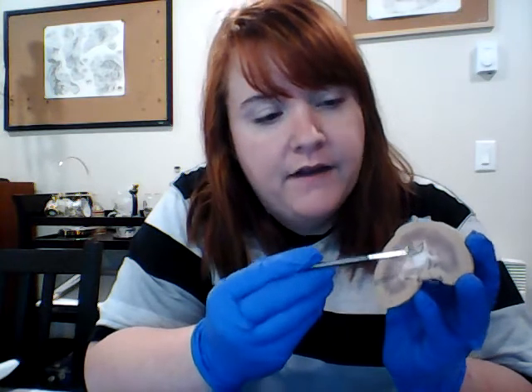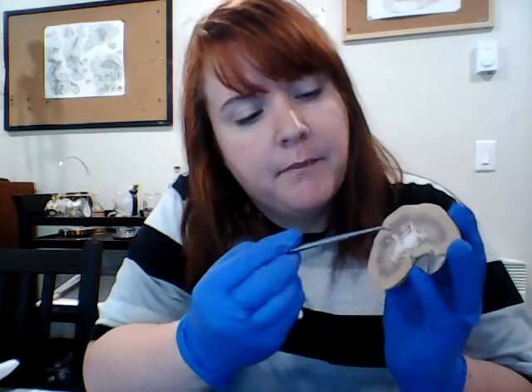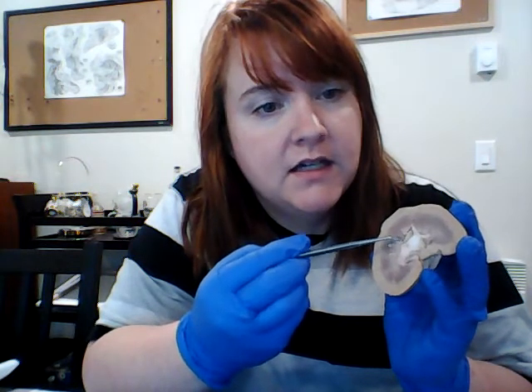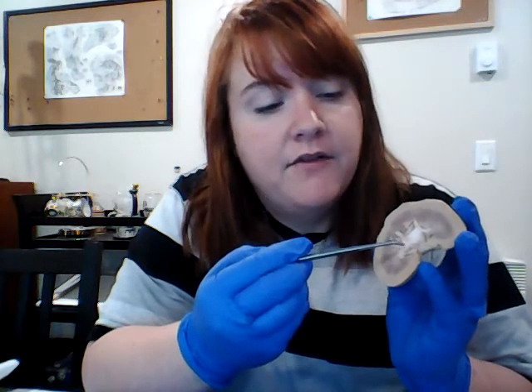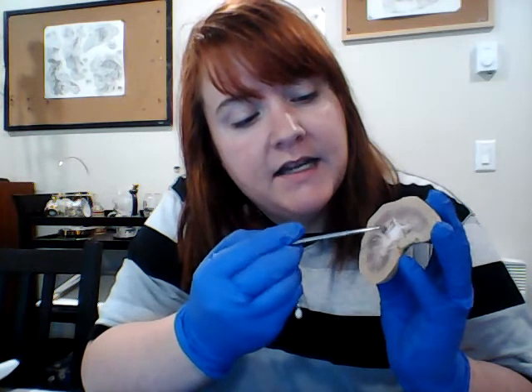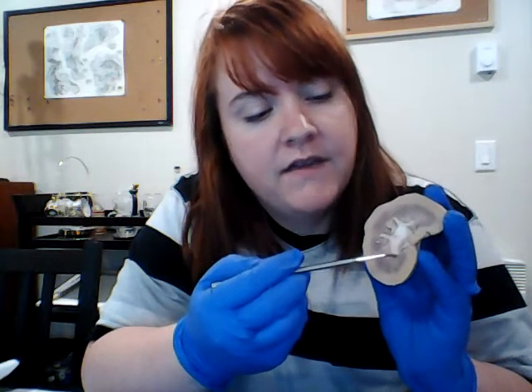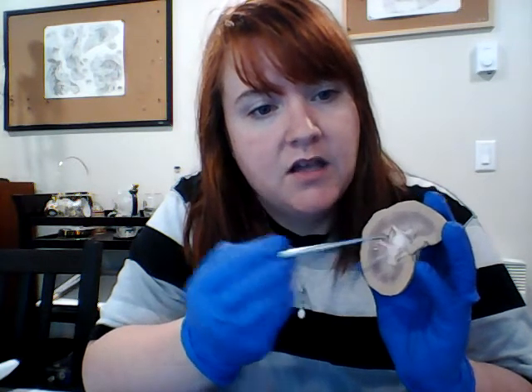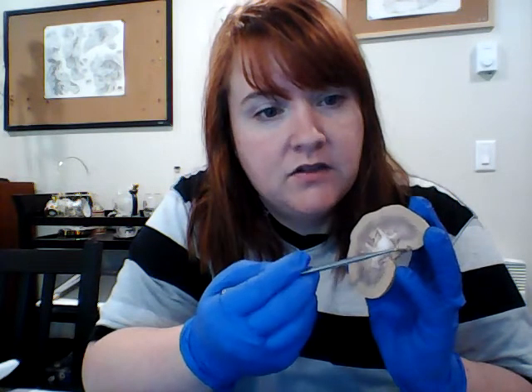And then we have inside here these little structures, like just past these white lines here, we have the renal columns, and then we have the renal sinus inside. So all of this space in between this whole section here, that's all the renal sinus. The renal hilum is this little section here.